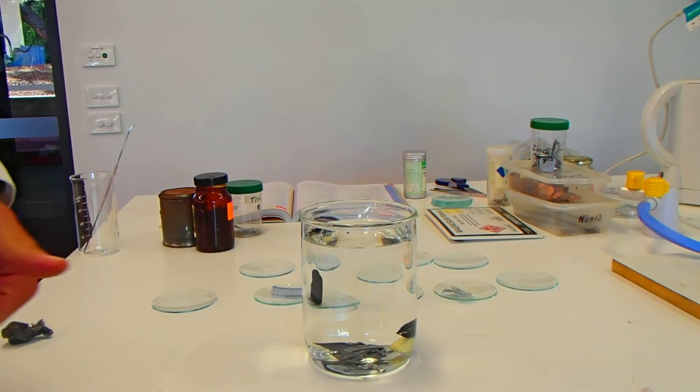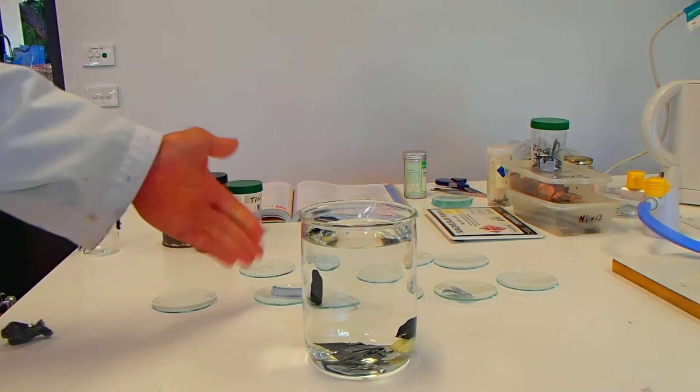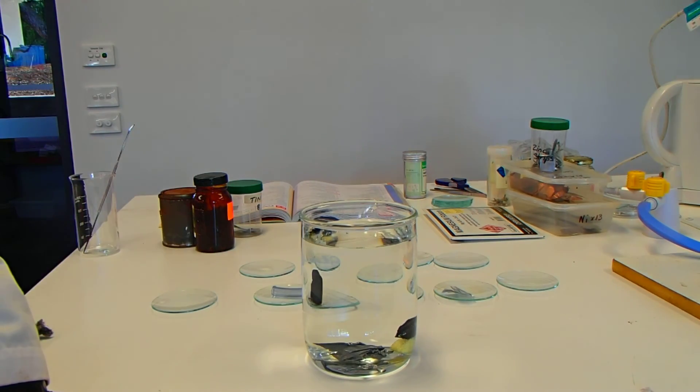So, most things sinking. Aluminum not, silicon not. And carbon and magnesium taking a little while to sink. So, that was video 4. Does it float or sink in the Properties of Elements Practical 5.2.